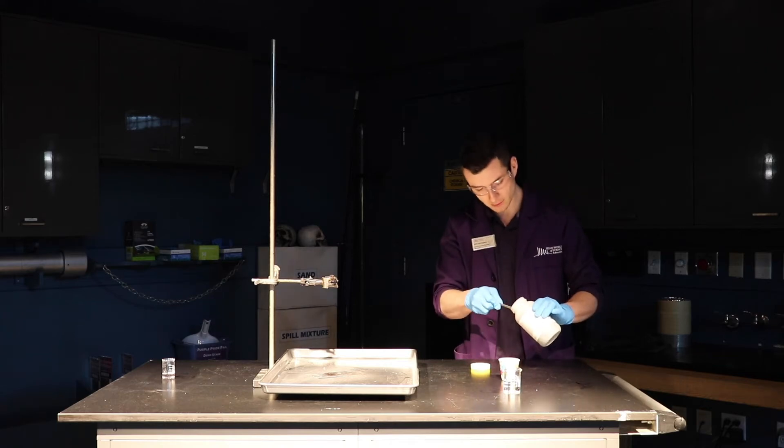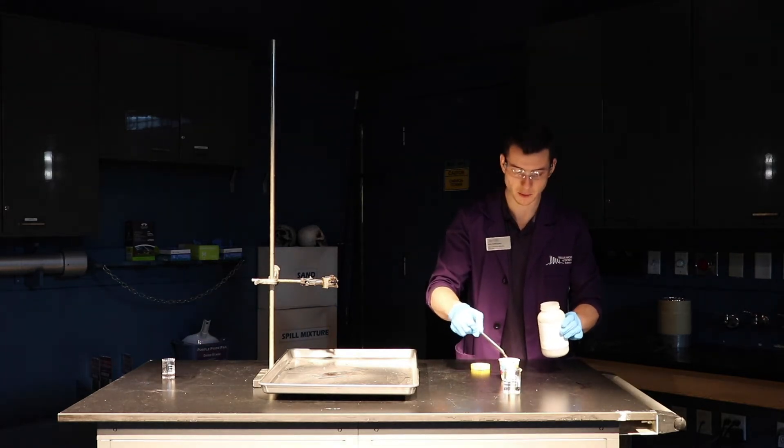Now the Purple Cow experiment uses only two ingredients. One, potassium permanganate.